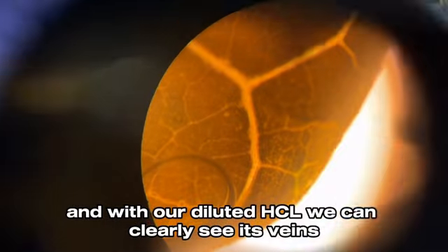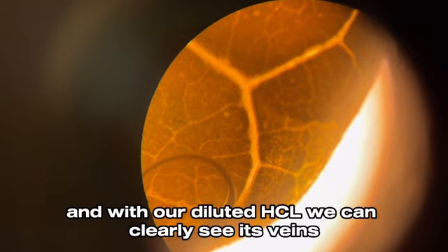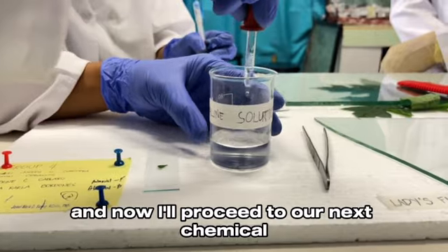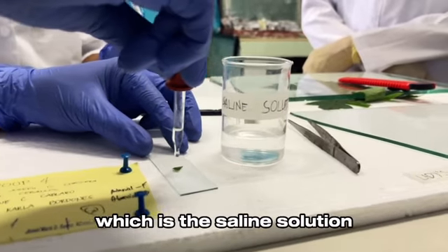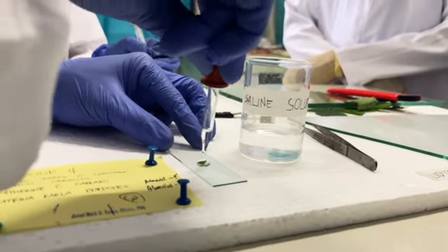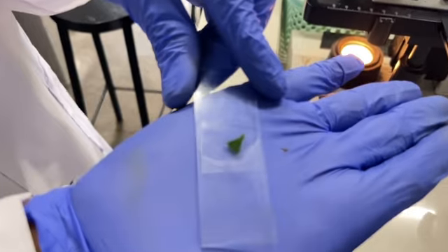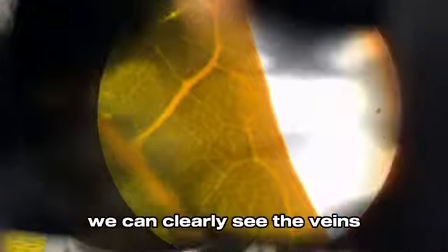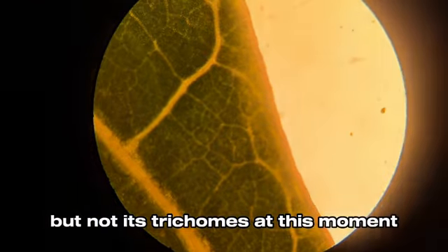With our diluted HCl, we can clearly see its veins, but we can't see its trichomes. Now we'll proceed to our next chemical, which is the saline solution. Just like our first chemical, we can clearly see the veins, but not its trichomes.